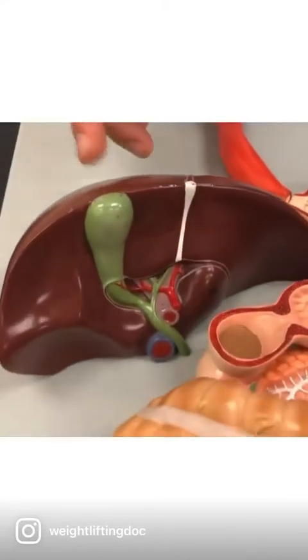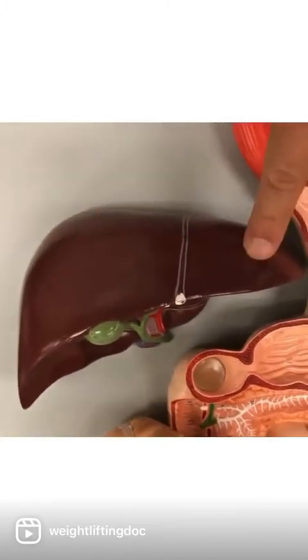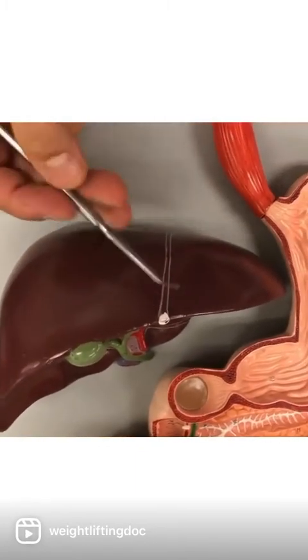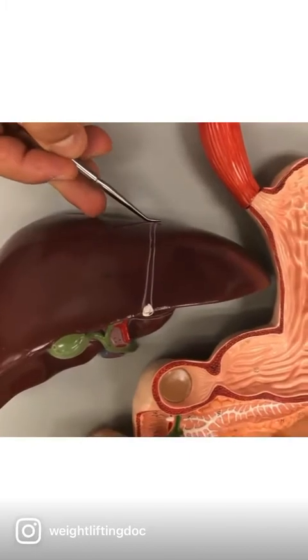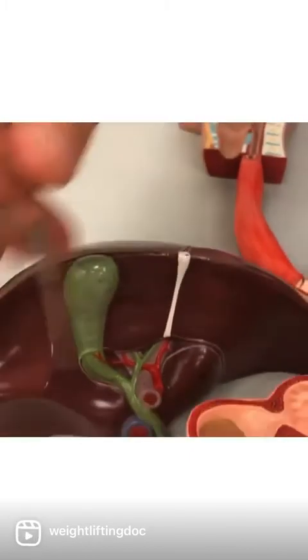So let's go up on top so we can see the right lobe and the left lobe. The right is the bigger, the left is the smaller, and they're separated by this ligament right here called the falciform ligament. Okay, now you can pan down a little bit. So right lobe, left lobe.